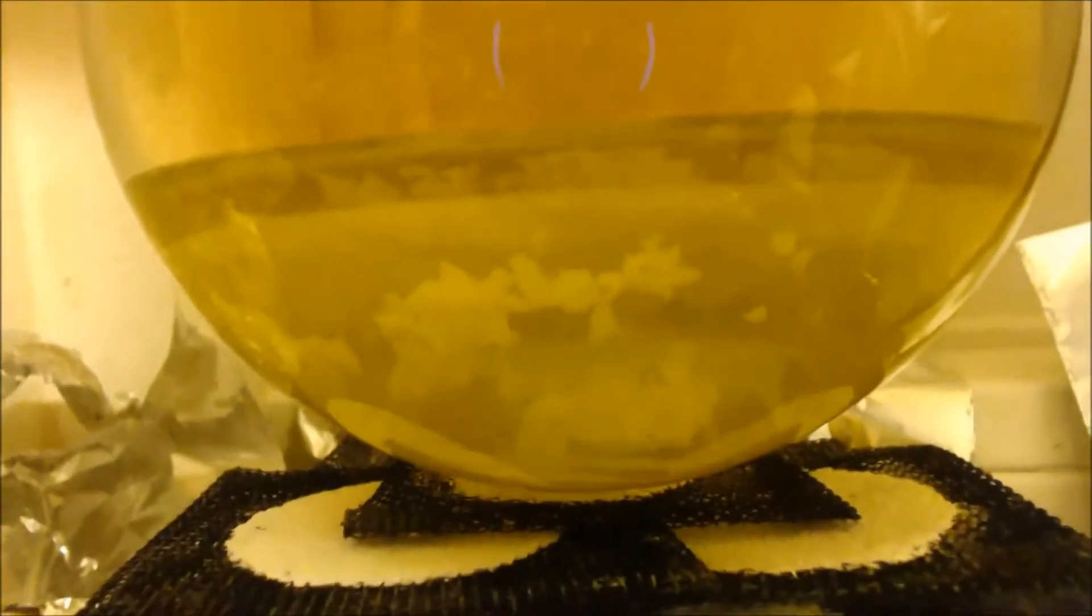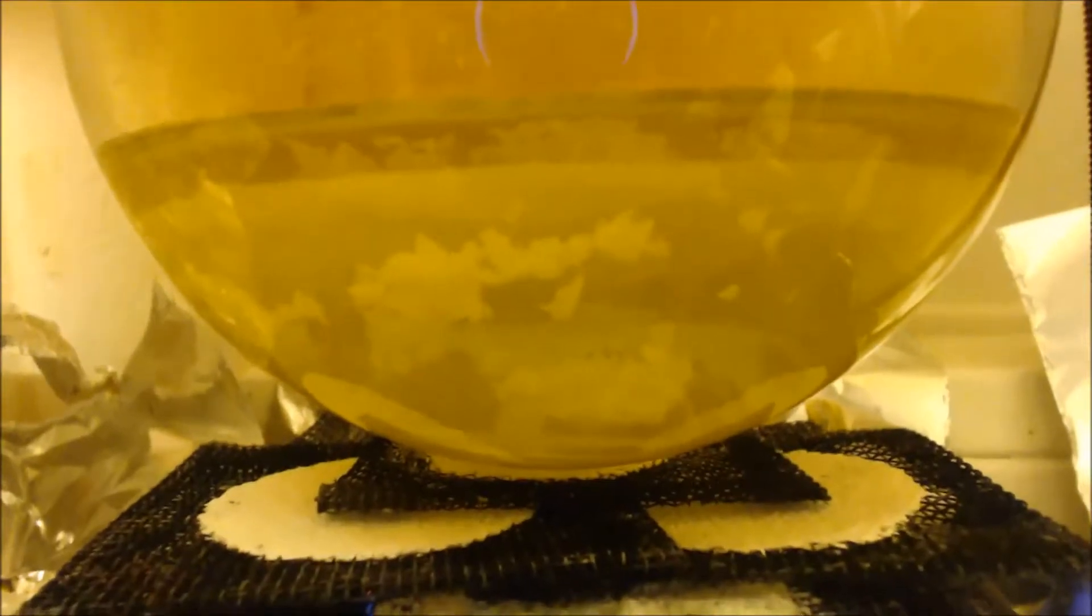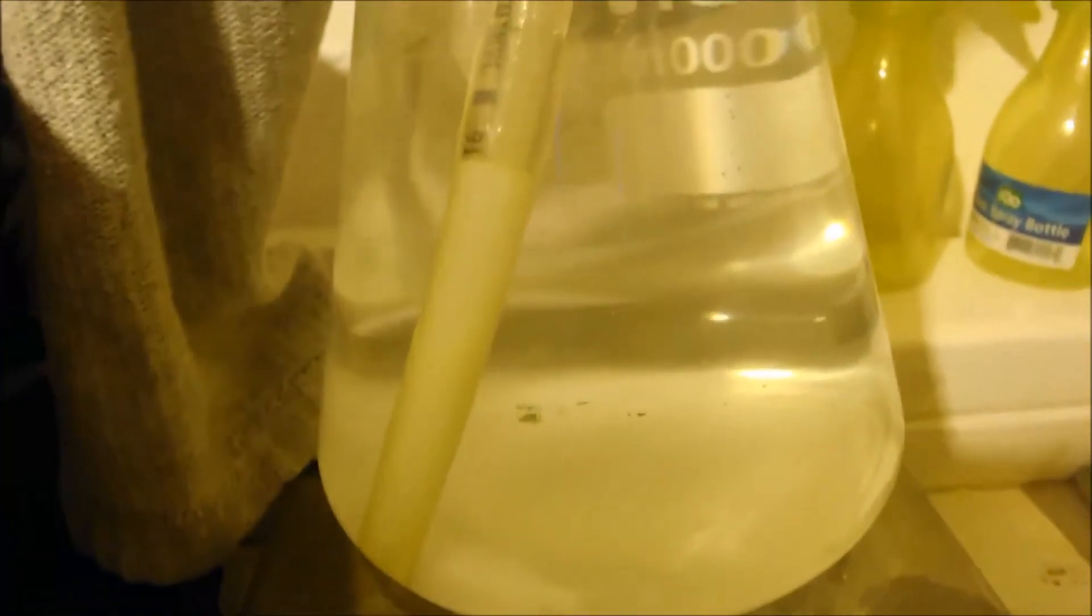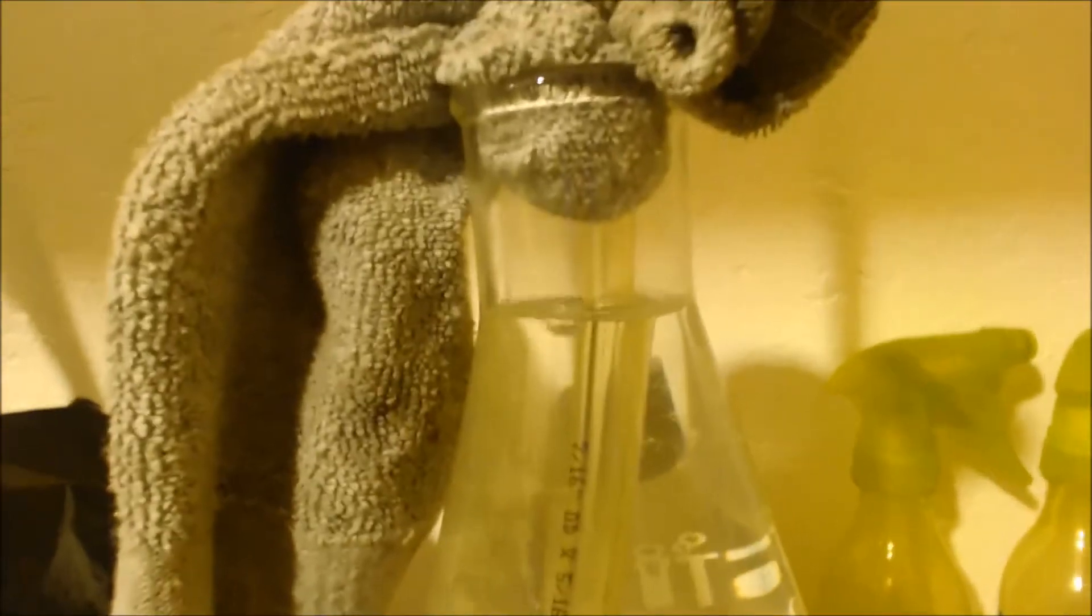It's only like 30, 40 degrees. The liquid is turning kind of green as soon as I turn the heat on. And there's no red gas up on top here. So it's all reacting before it gets up there. But trust me, it'll start getting gas soon. It never seems to scrub this crap.